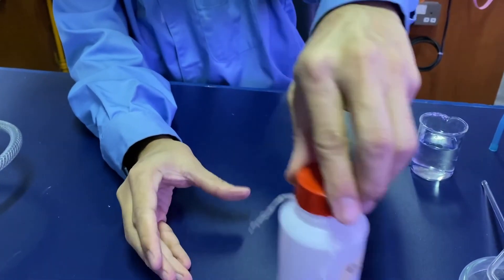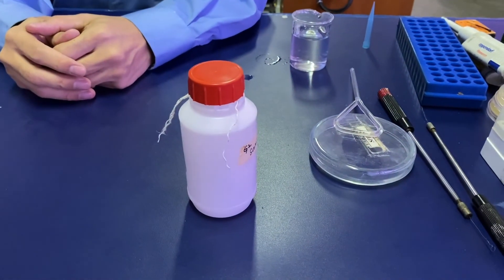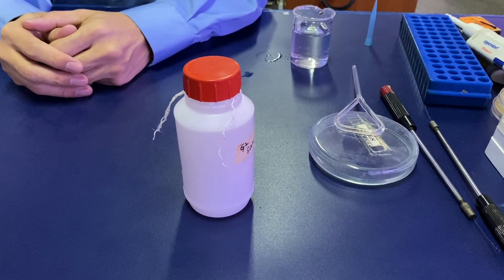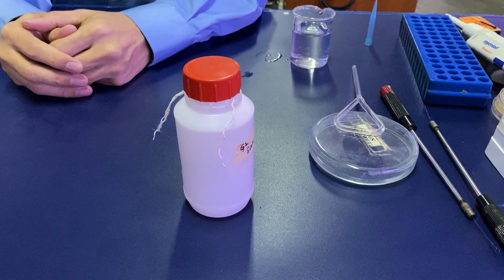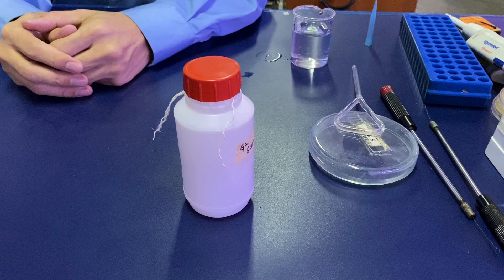Then you can screw it tight. That's how you prepare the soil respiration bottle.